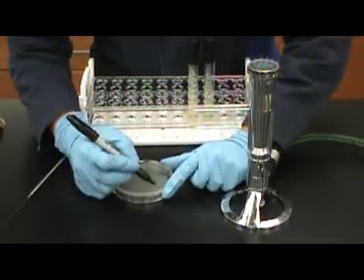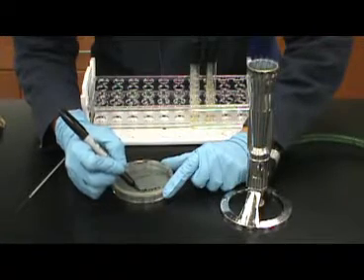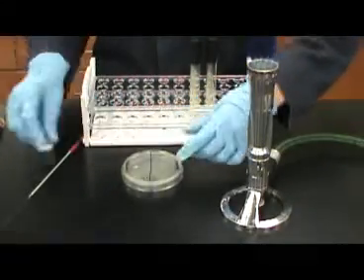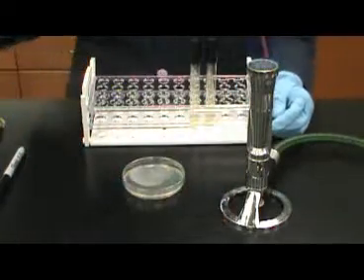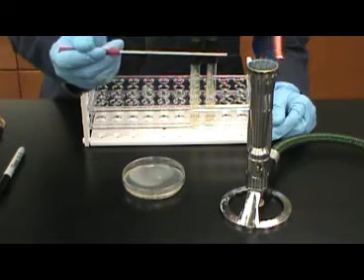Begin by drawing a line down the center of your plate and then labeling each side of the plate with the bacteria you are going to use to inoculate it. You will use aseptic technique to draw a straight line inoculation on the surface of the agar.